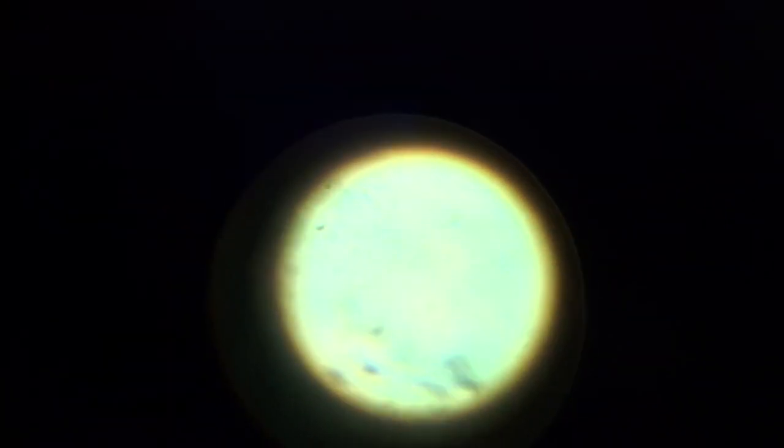Penicillium under low power — under 100 times magnification, which is higher than the stereomicroscope — is difficult to see. Let's look at it under high power.